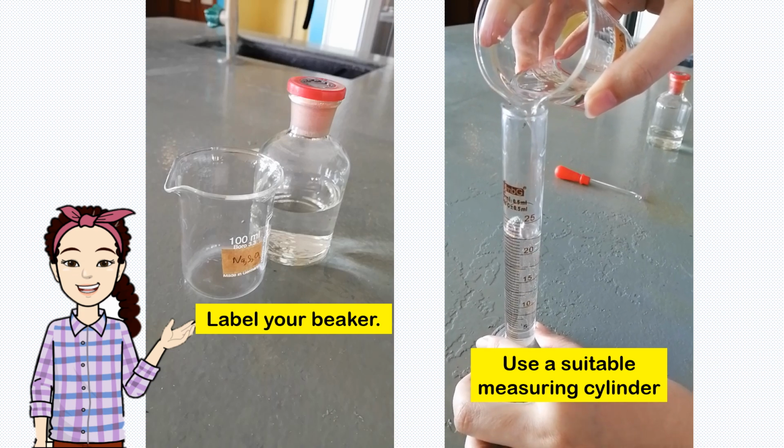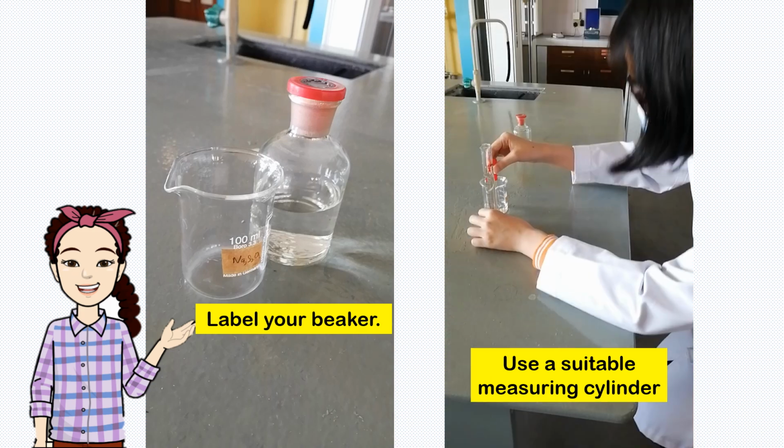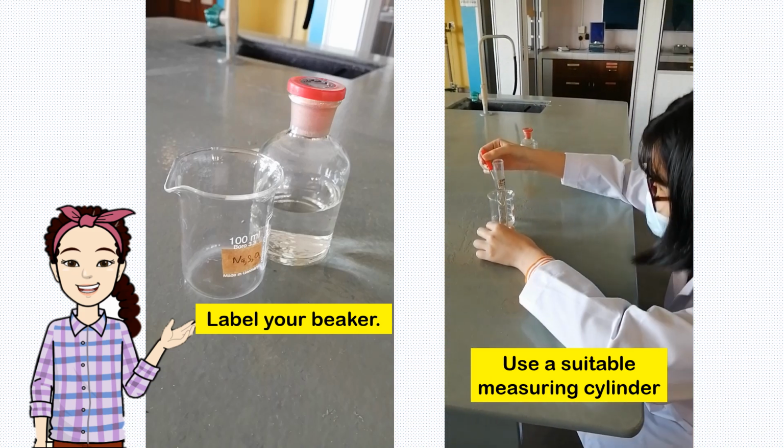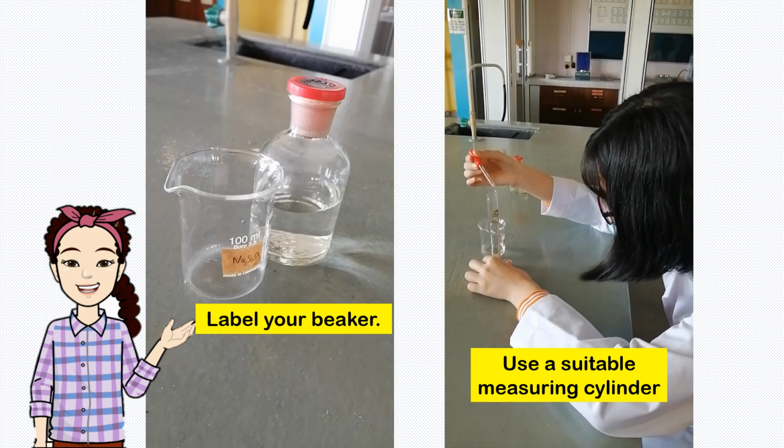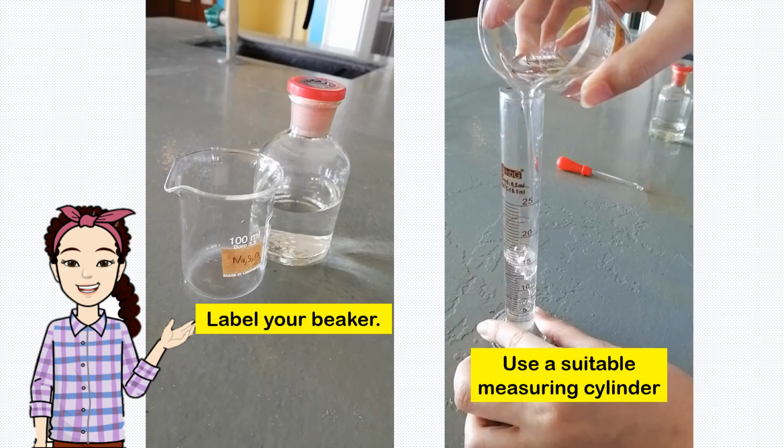Next, use a suitable measuring cylinder and measure the amount that you need in your experiment. Make sure your eyes are perpendicular to the meniscus level.